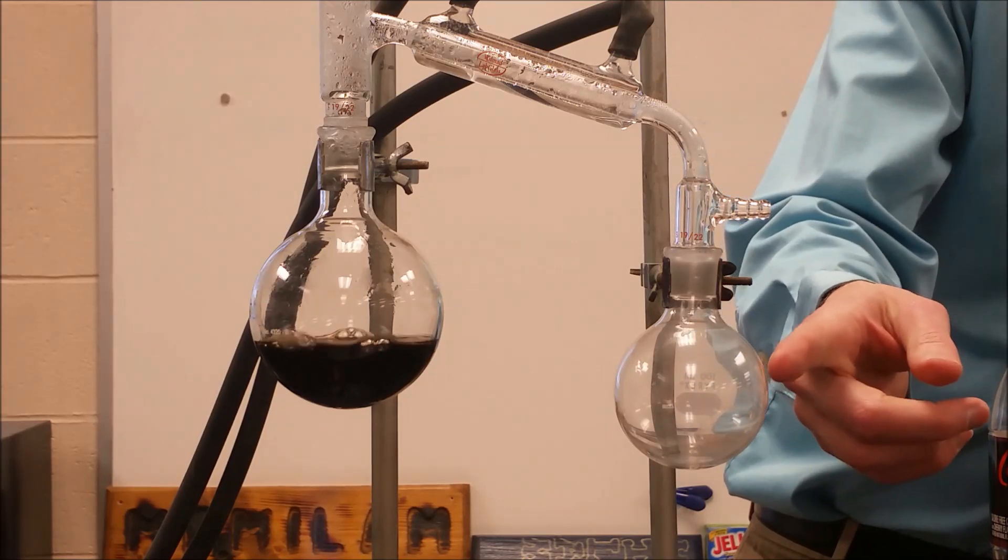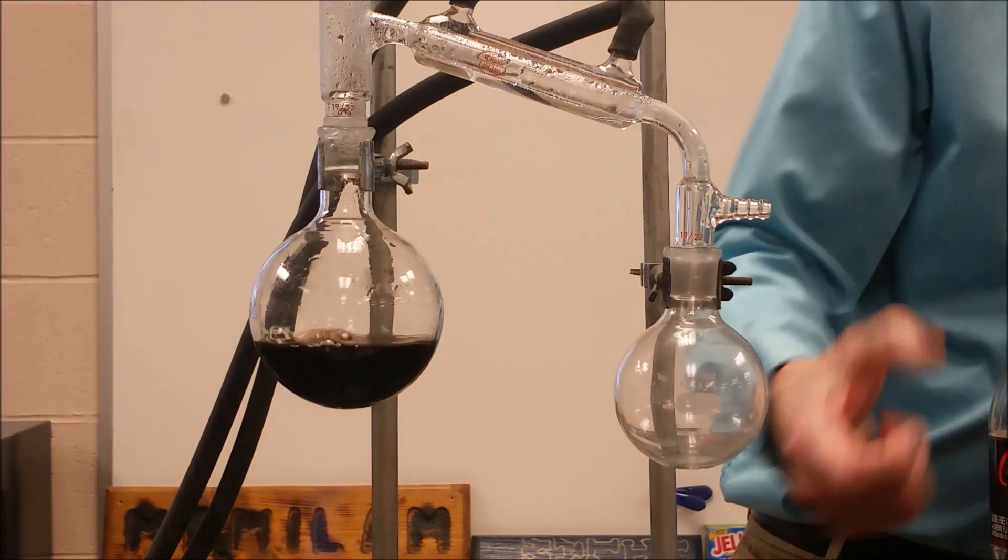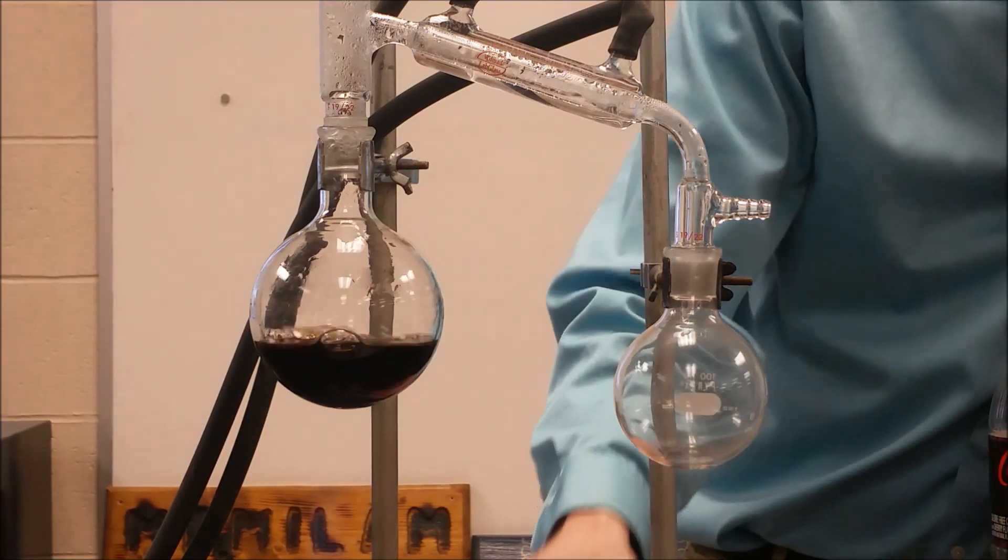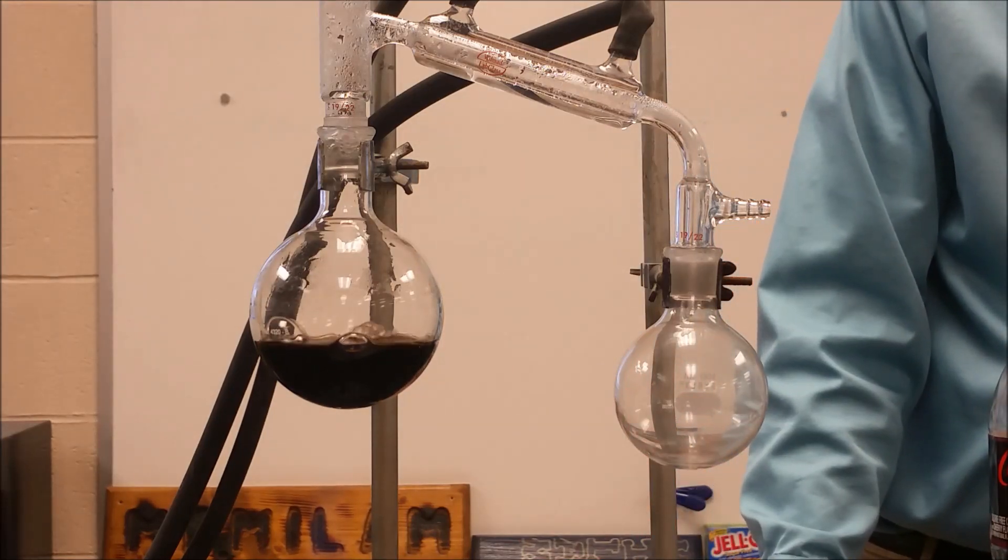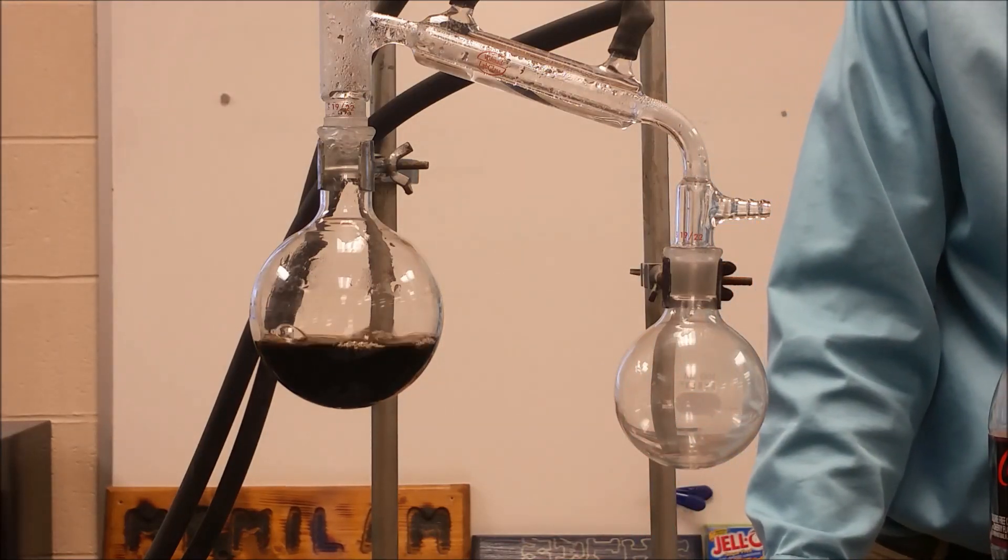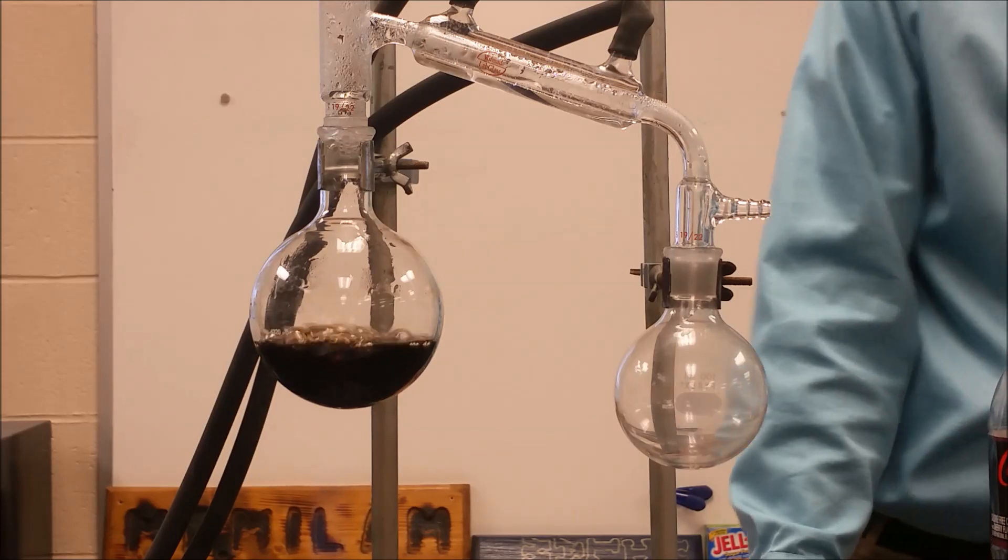So now we're starting to see drops come down periodically and hopefully that's the cherry flavoring or whatever mixture of water and cherry flavoring that we're looking for. We'll let that run for a little longer and then we'll check it.